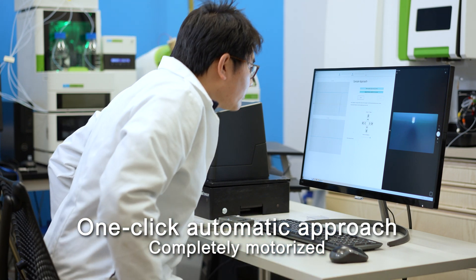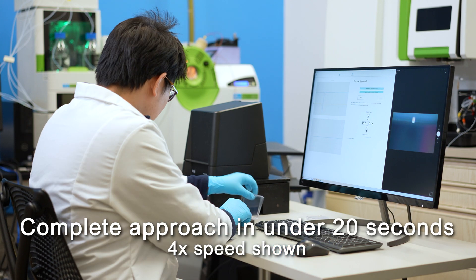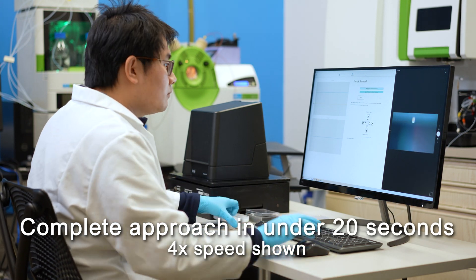Now do a one-click automatic approach from the tip to the sample. A built-in sensor detects when the approach is complete.